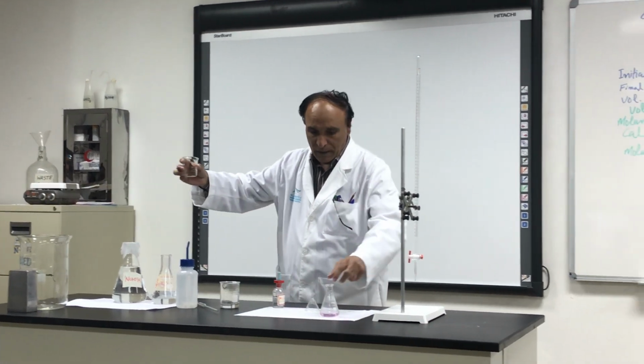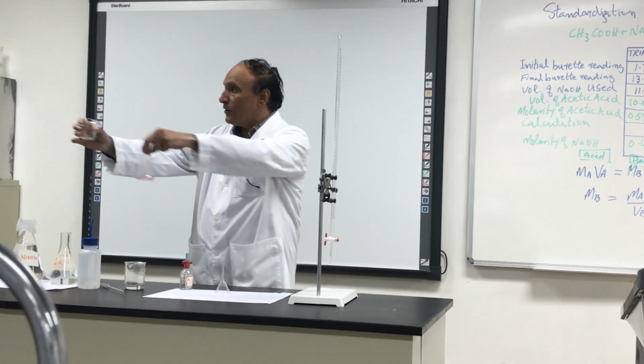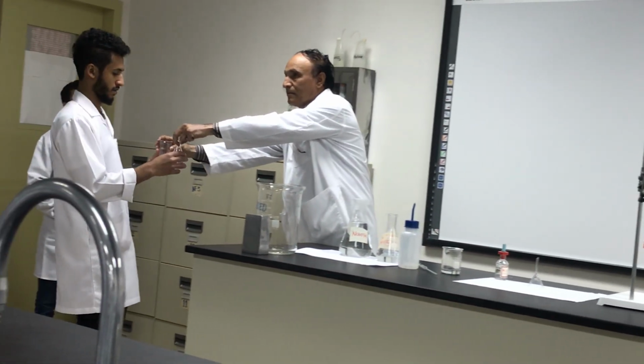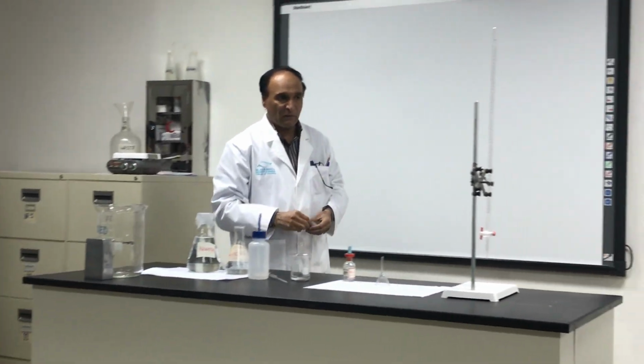Yes. Can you please wash both of them? Any one of you go and wash both of them with the water. Bring the wash with the water.